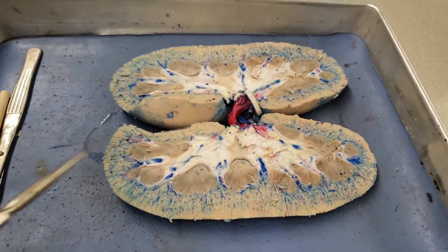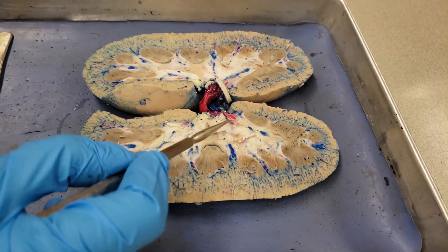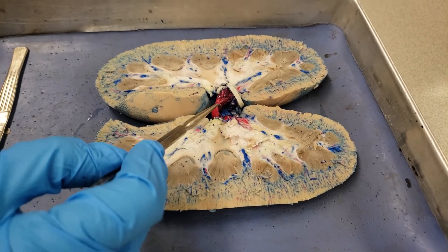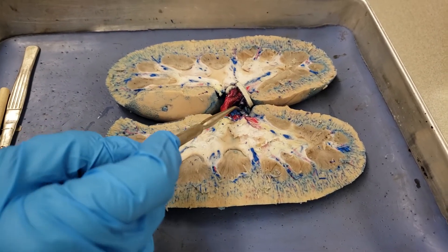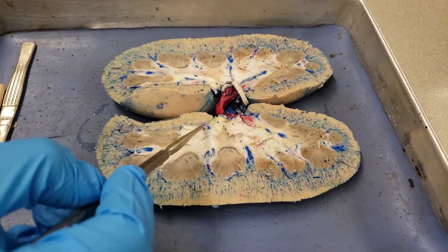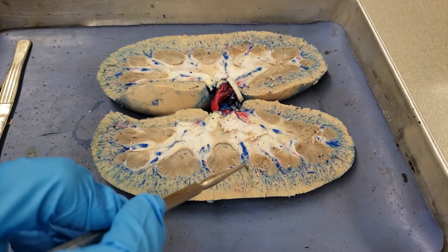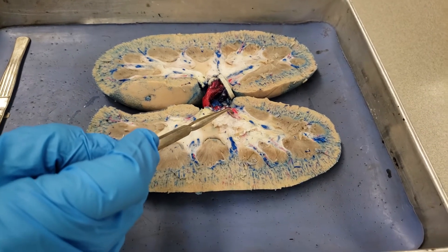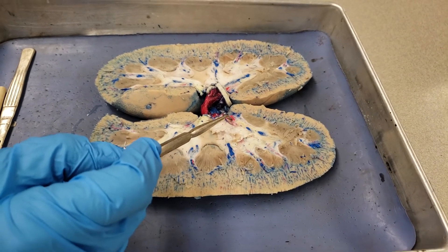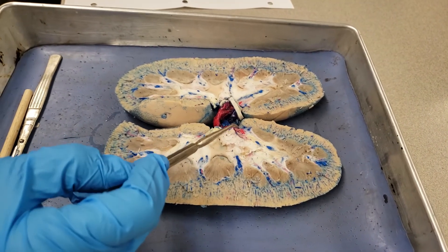Segmental arteries — this is actually a segmental artery right here. As soon as it branches off the renal artery and there's more than one, but we're not in the lobes yet, that's segmental. The weird part is there is no segmental vein, so it won't be asked about.